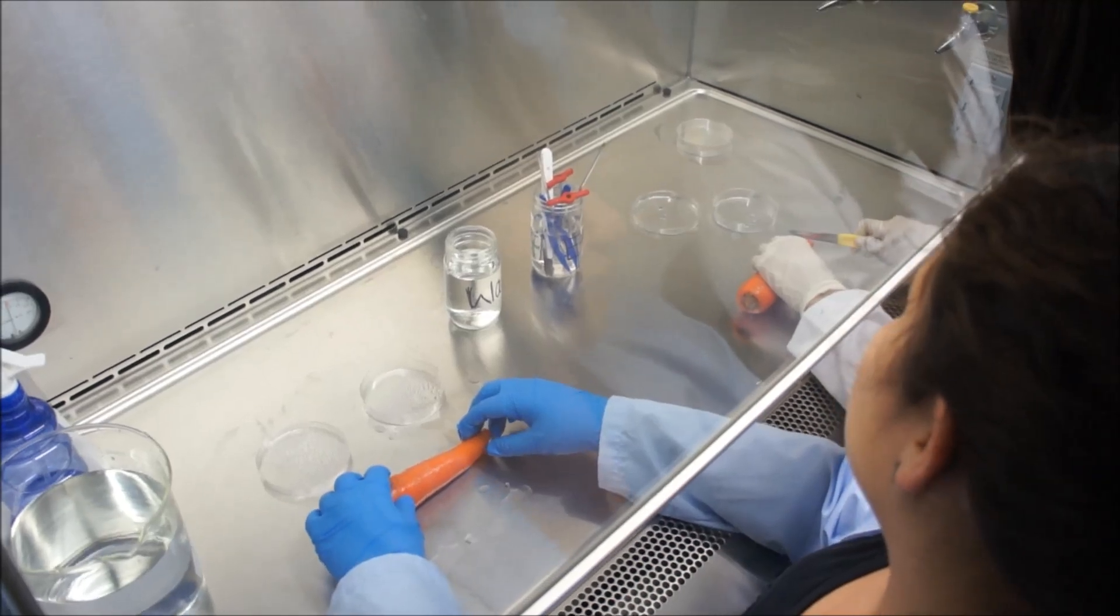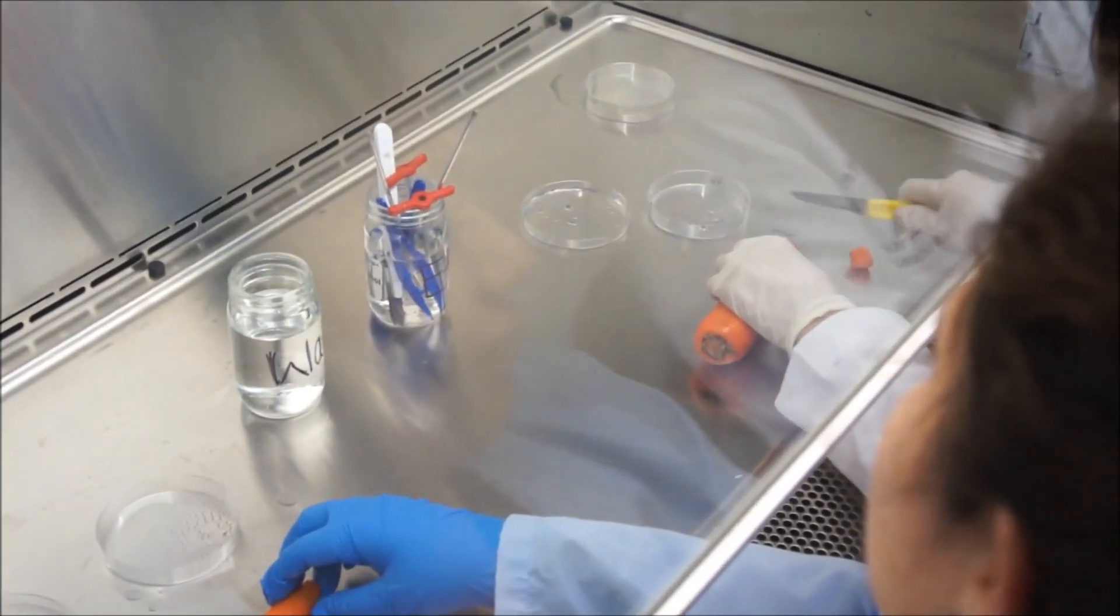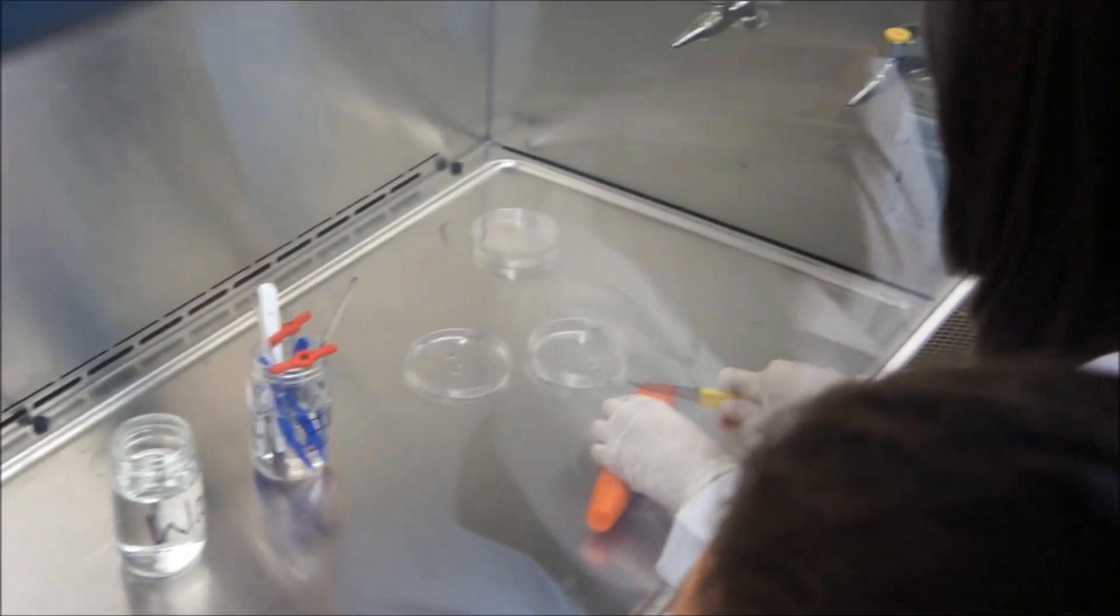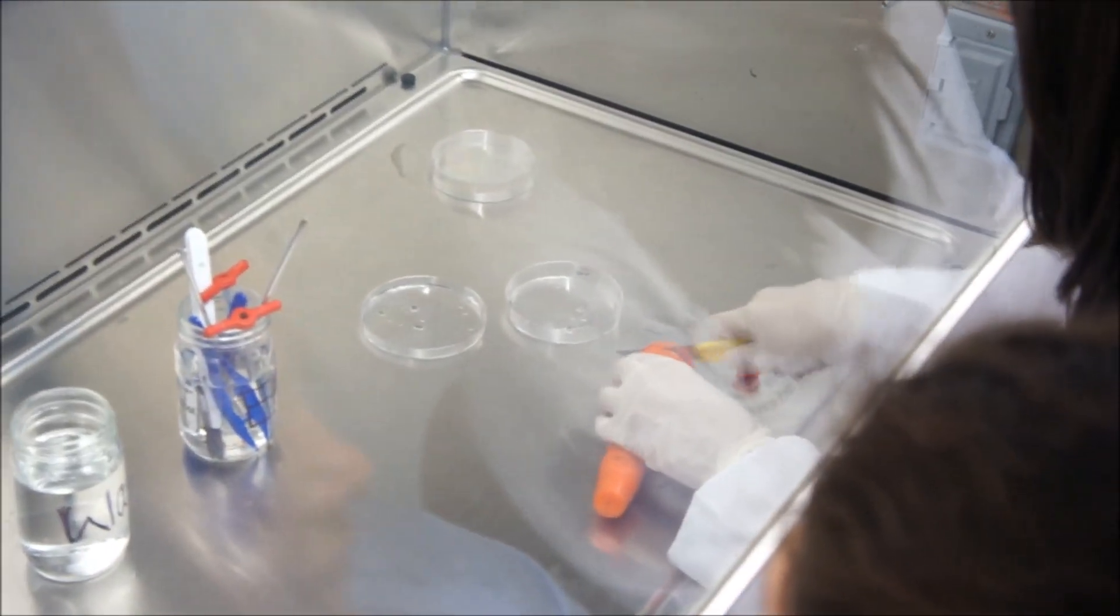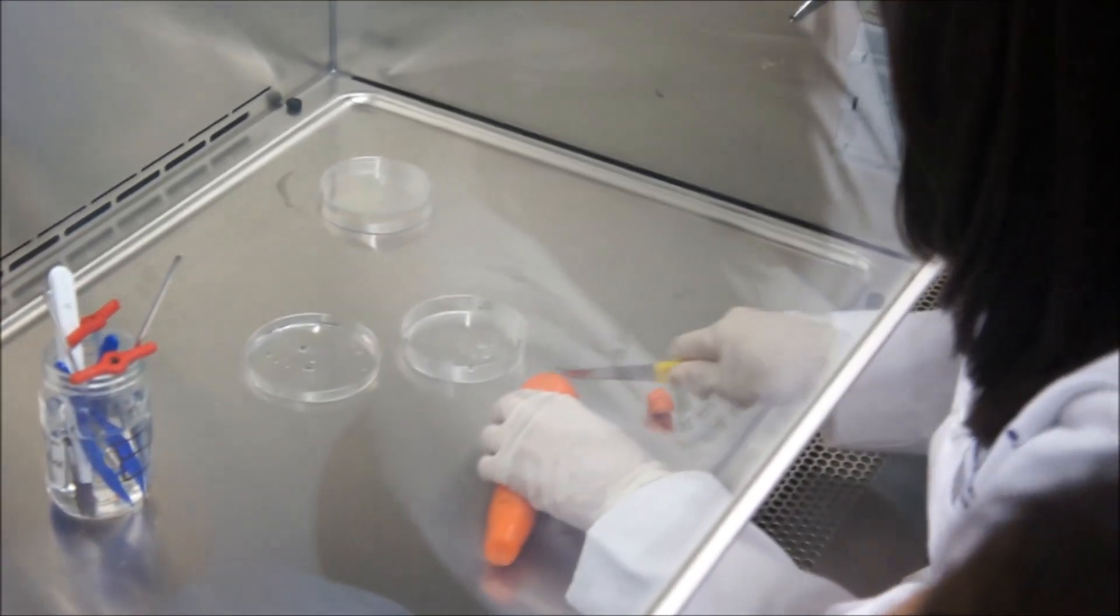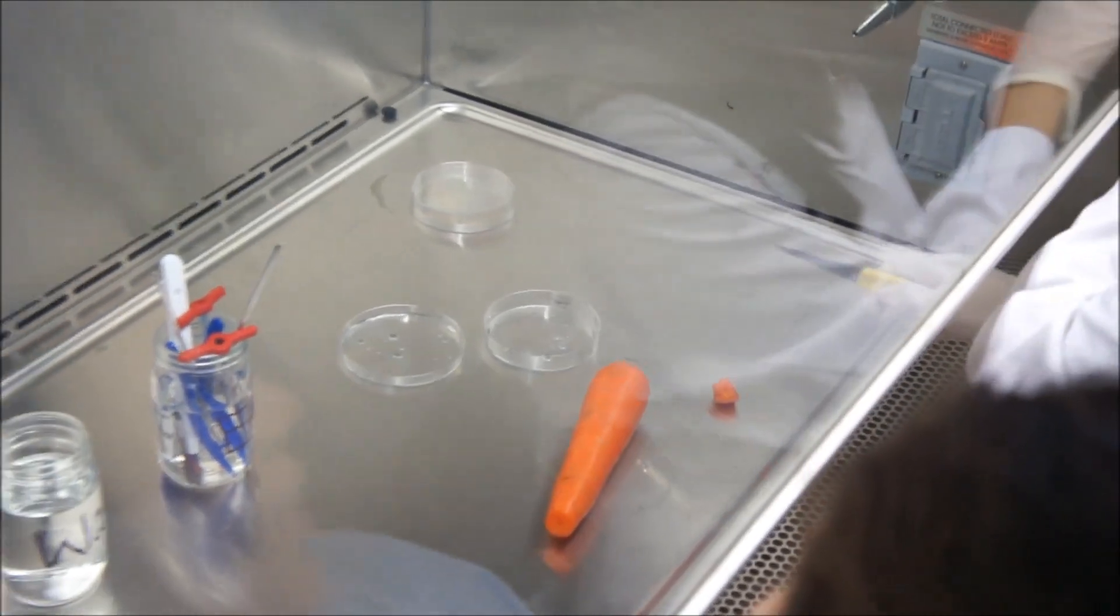Holding the carrot in your hand, break off the large end, then the small end, and discard it. Be careful not to touch the newly exposed surfaces.